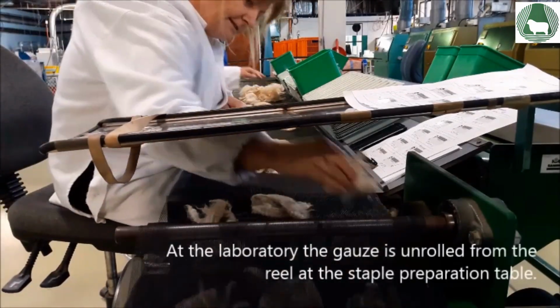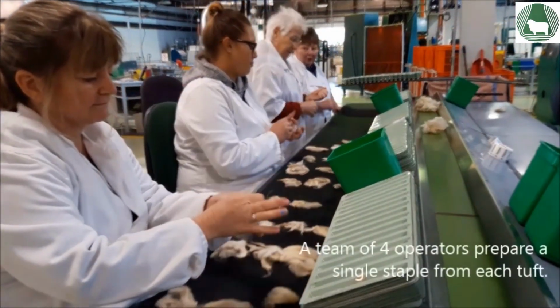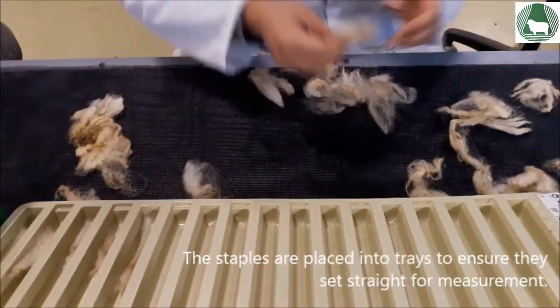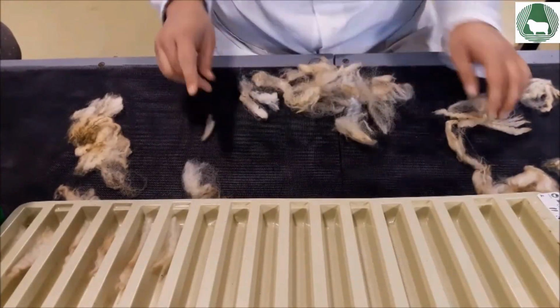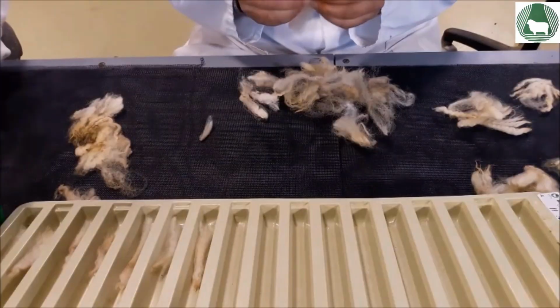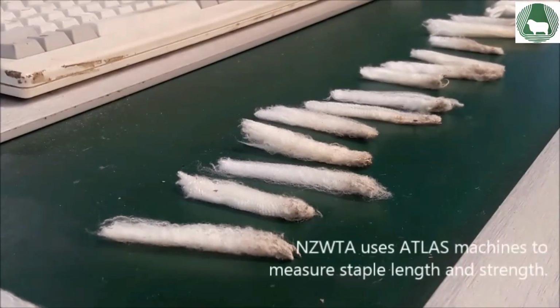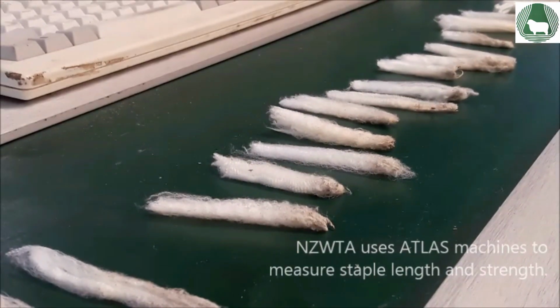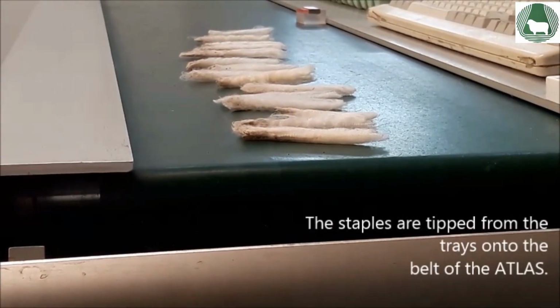At the laboratory, the gauze is unrolled from the reel at the staple preparation table. A team of 4 operators prepare a single staple from each tuft and place the staples into trays to ensure they sit straight for measurement. NZWTA uses Atlas machines to measure staple length and strength. The staples are tipped from the trays onto the belt of the Atlas.